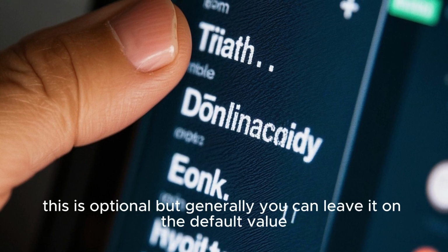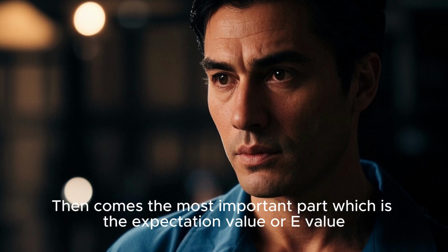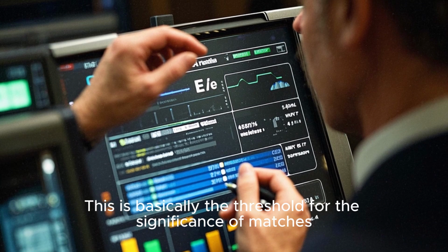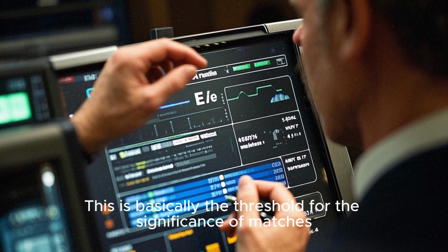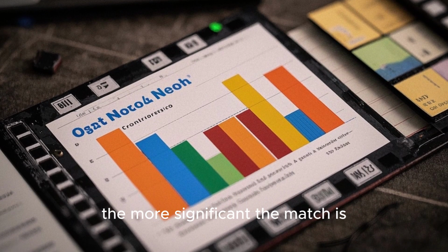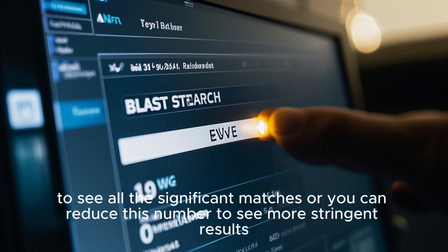Now for the word size, this is optional, but generally you can leave it on the default value. Then comes the most important part, which is the expectation value or E value. This is basically the threshold for the significance of matches. The lower the E value, the more significant the match is. Generally, you can set this to 10 to see all the significant matches, or you can reduce this number to see more stringent results.